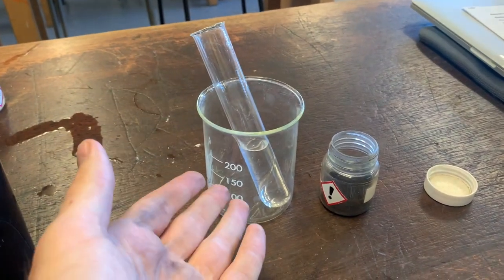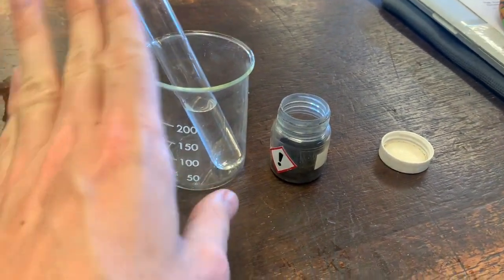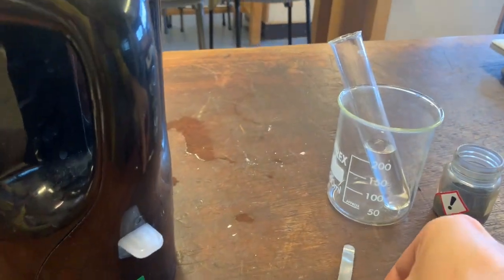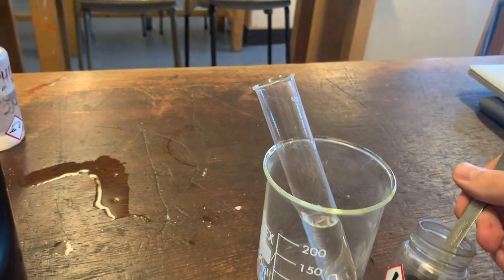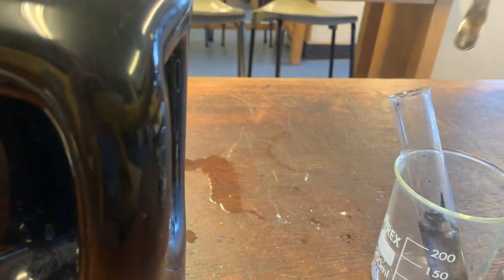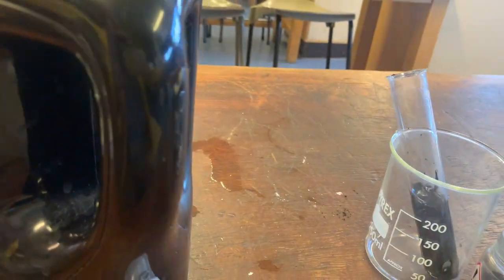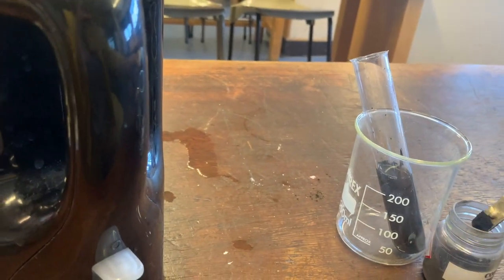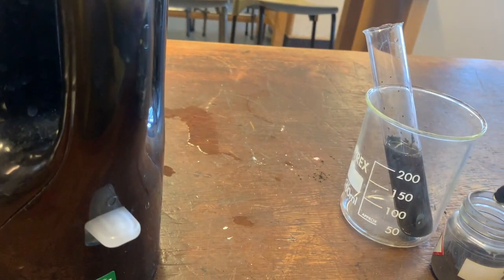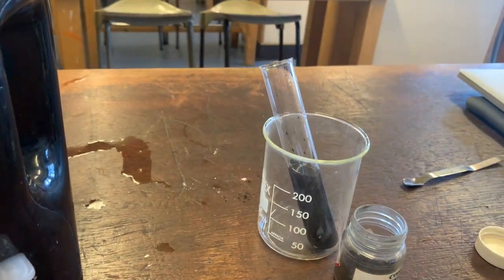So here I've put the sulfuric acid into this boiling tube and just kept it in a beaker — this will become important later. So what I'm going to do is just take a heaped spatula of copper oxide and put it into the sulfuric acid, and we're going to do a few of these. I want to use quite a lot of copper oxide. You've got to put in too much because we really want to make sure that all of the acid has completely reacted by the end of this experiment.